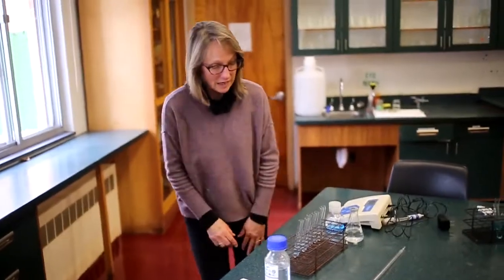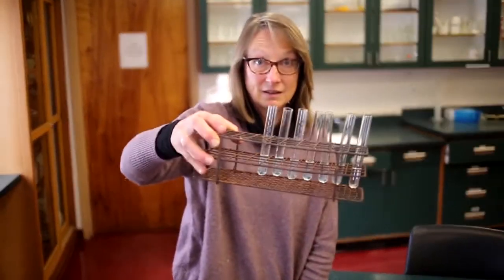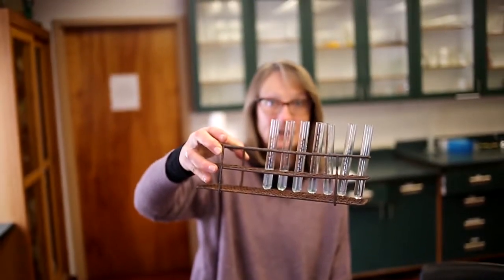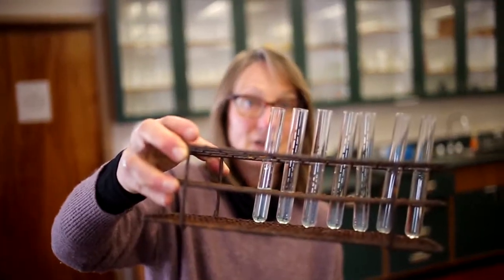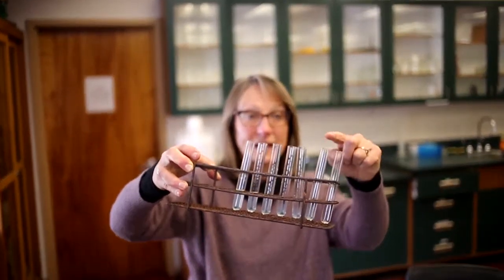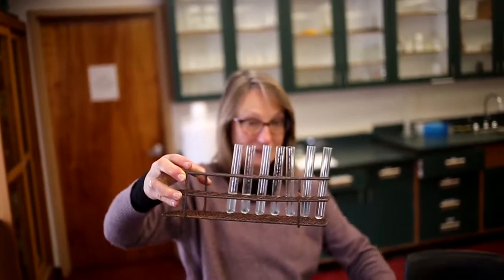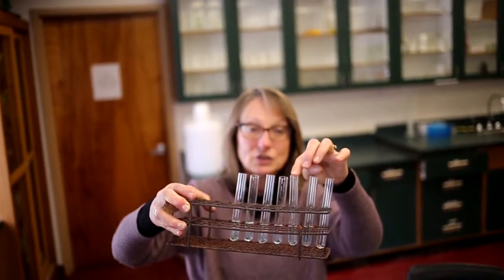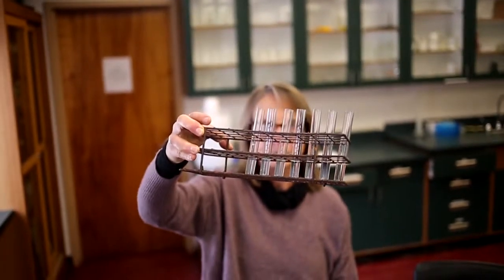And what we've done is set up a series of dilutions. Very, very dilute copper sulfate. You probably can't see any blue color at all in there, at least not very much. Right, so the first tube has just water. The second tube has water and 1 drop of copper sulfate. The third tube has water and 2 drops. It says 3, 4, 5, and 6, but you really can't see the blue color at all.